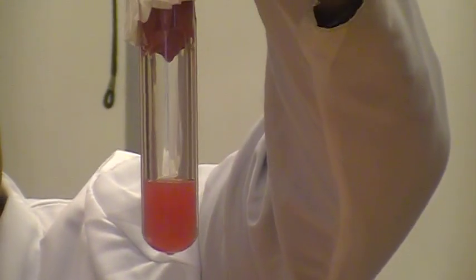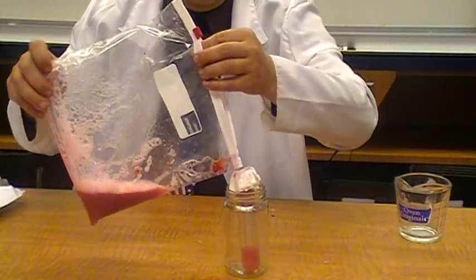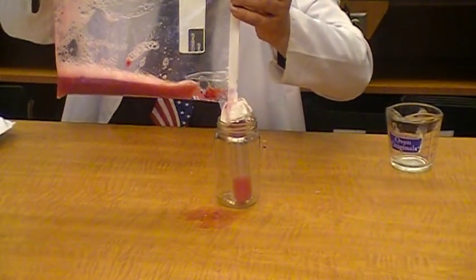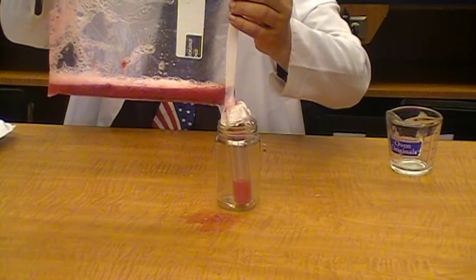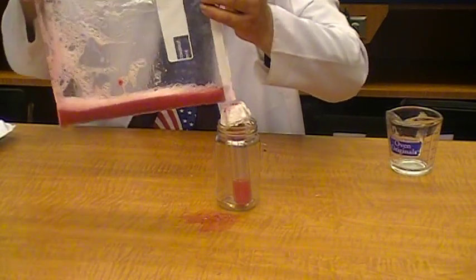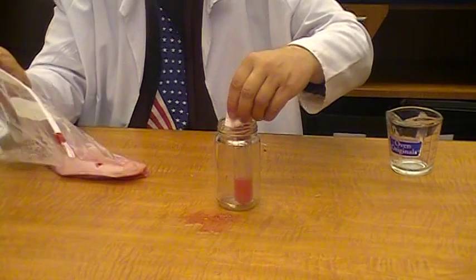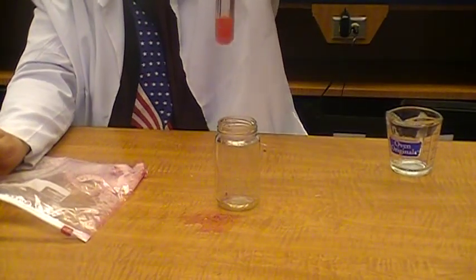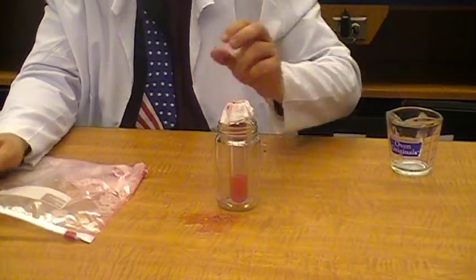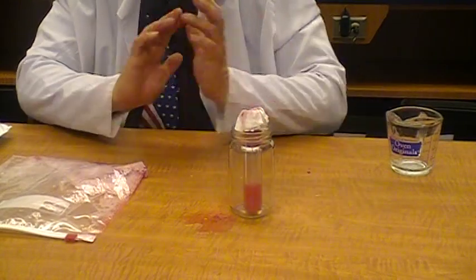Okay. And here we can see we're getting more of a soup forming. Let's see if I can add just a little bit more and just get that test tube filled up as much as we can. So, while the test tube is filling up, what we're going to want to do now is use the alcohol.